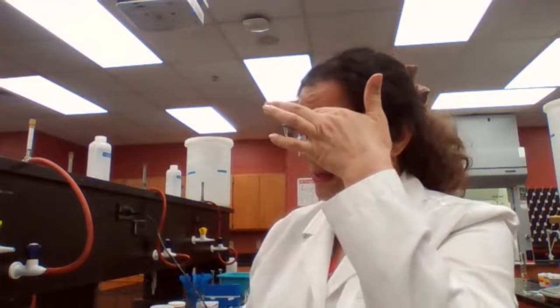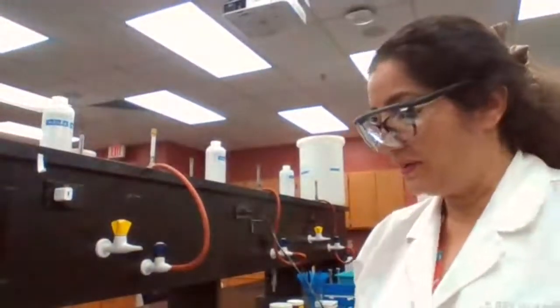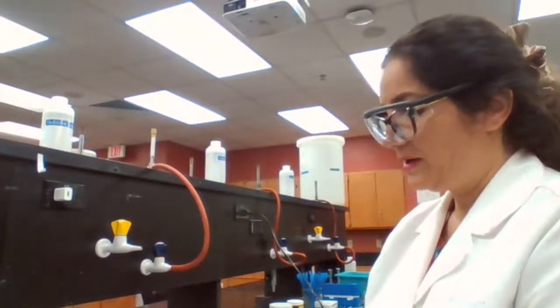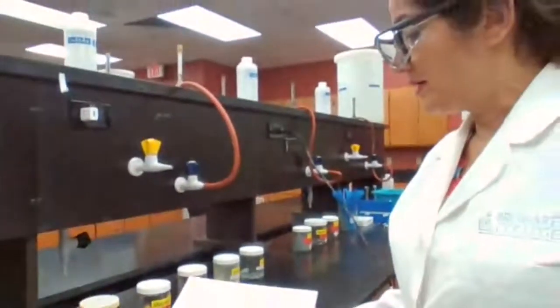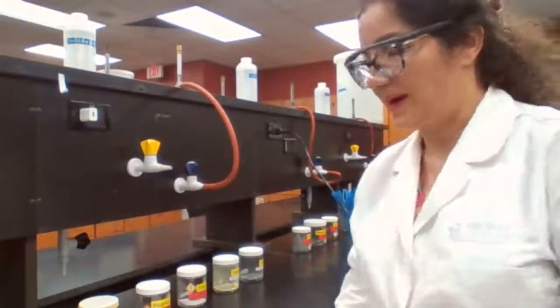first video. So, for the first part of the experiment, this experiment is about physical and chemical properties of different substances, like elements and compounds, and we want to learn about the classification of the chemicals based on the physical changes of the matter and the chemical changes of the matter.